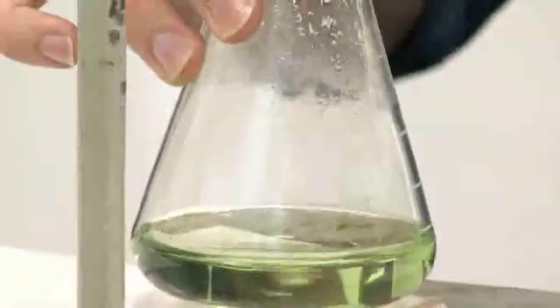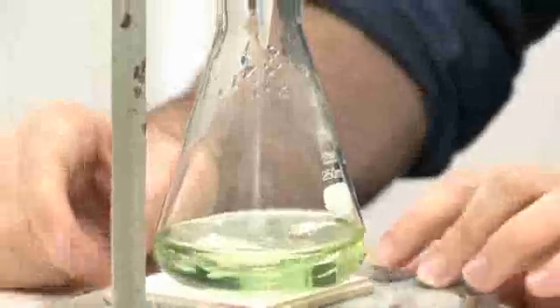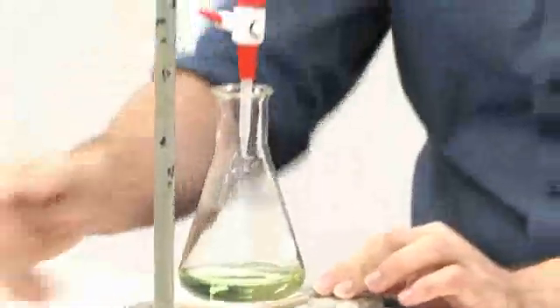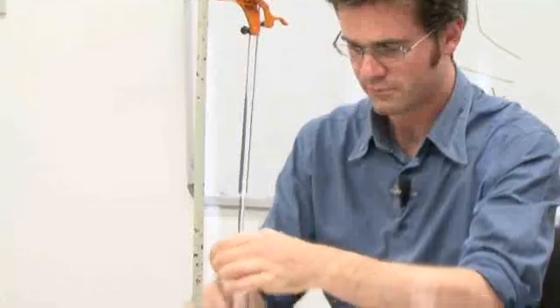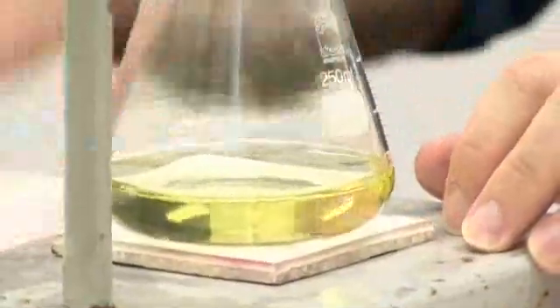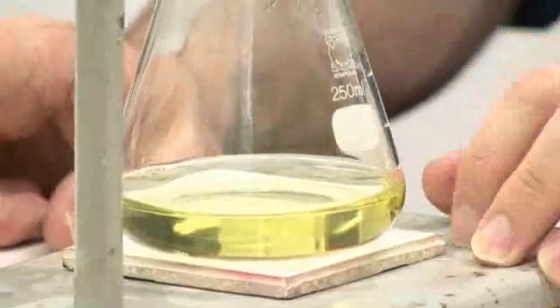Did you see that? But notice how it turned. So your first one is always rough. So you see how easy it is to go from blue to yellow. And if you add a little bit more, you see it goes completely yellow. So in fact, we're very close to the end point and the equivalence point.